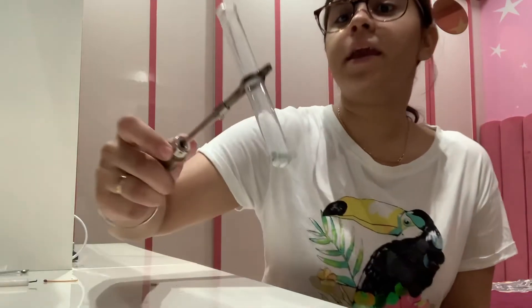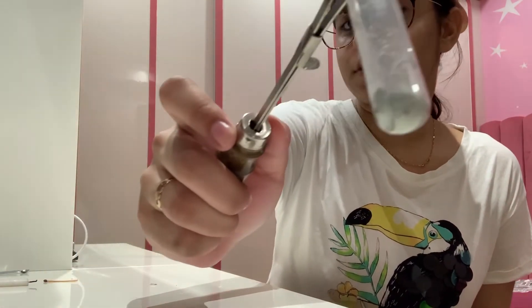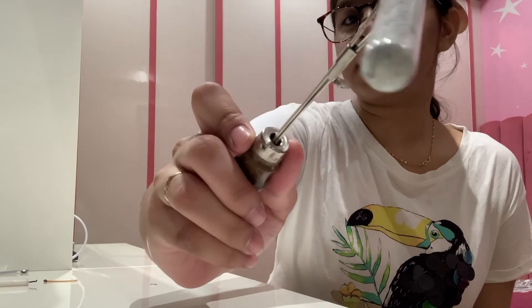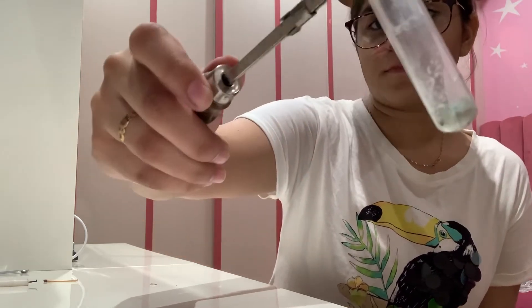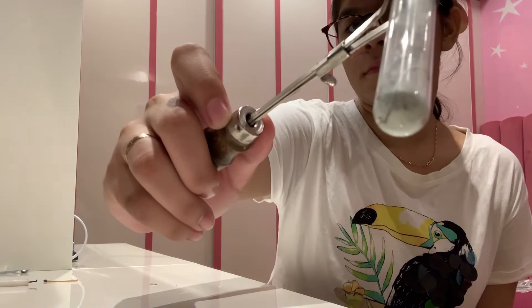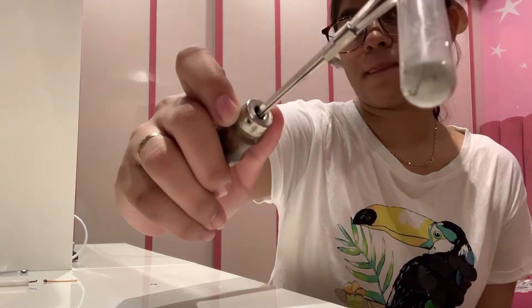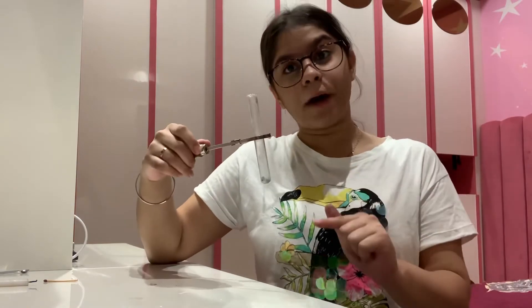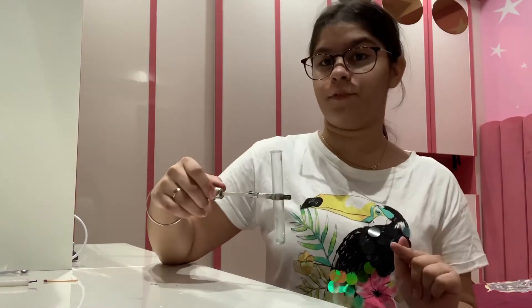After the heating, we can see that the blue crystals have now turned into a white powder. This white powder is the anhydrous form of copper sulfate.